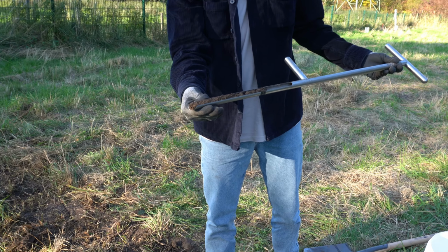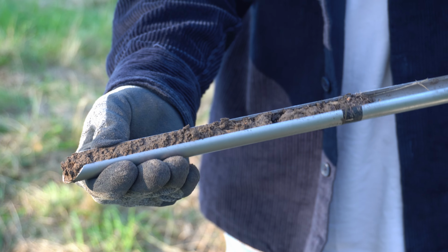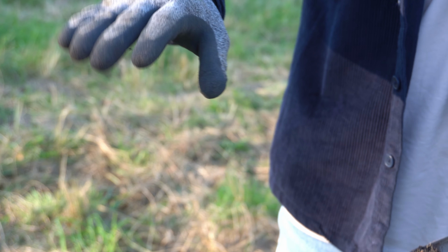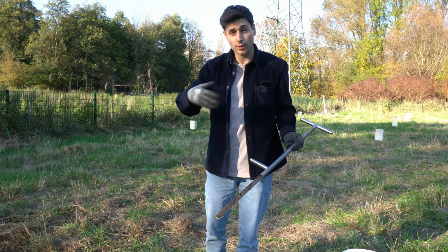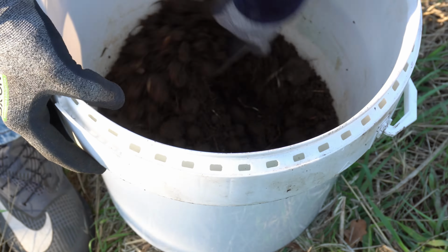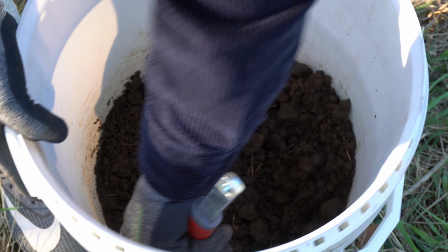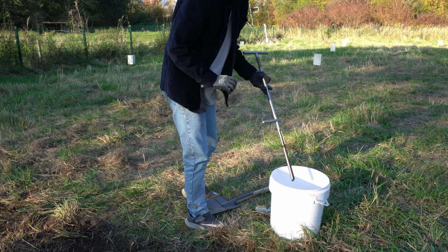It could be a plastic bag. Or if you want to mix a composite sample, you would now go on and follow the grid pattern or a random pattern to collect multiple subsamples, which would then be transferred to the bucket, mixed in the bucket, and then again packed into a bag or a little cardboard box maybe, for further analysis in the lab.